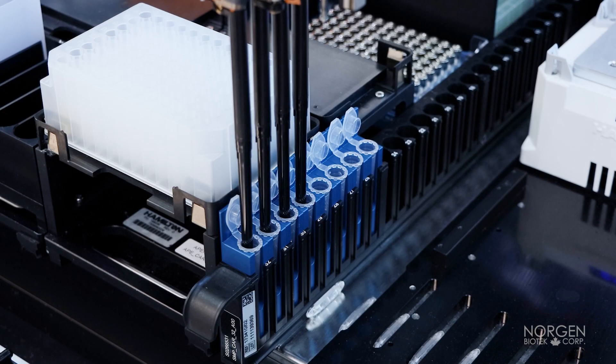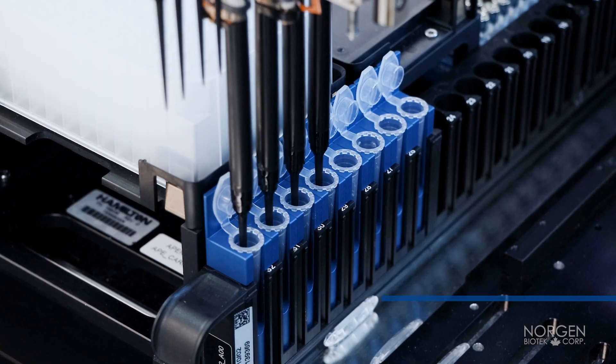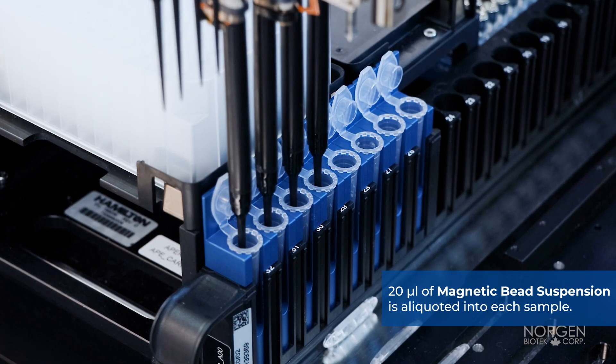The magnetic bead suspension is premixed to ensure homogeneity, and then 20 microliters is aliquoted into each sample.